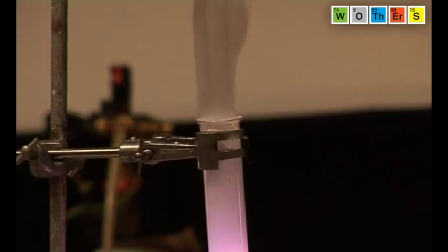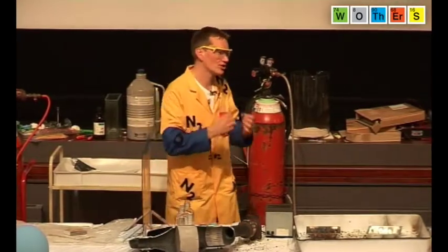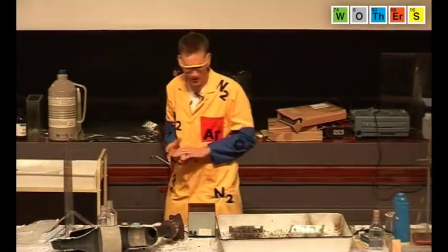So we've seen how the oxygen comes from plants most of the time, from photosynthesis. That's where the oxygen in the air comes from. We've seen that we can chemically generate this by heating up something like the potassium chlorate here. It's still going. It'll finish in a moment. There we are. It's just about to finish.